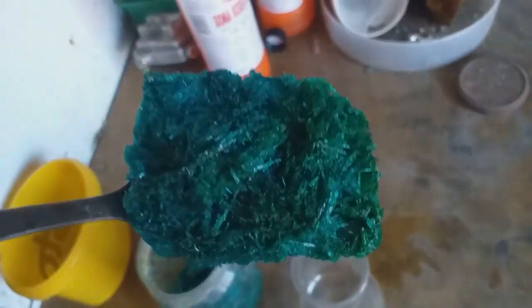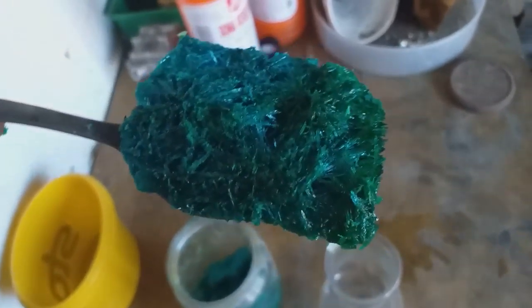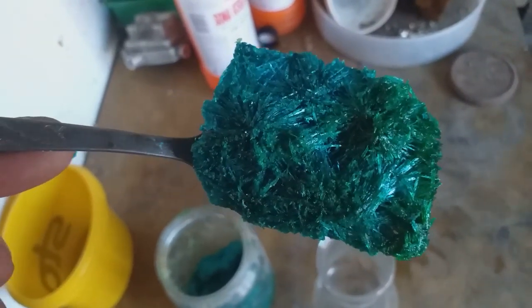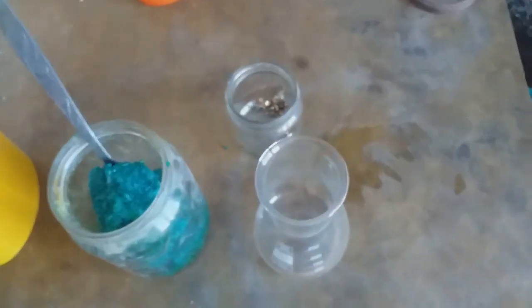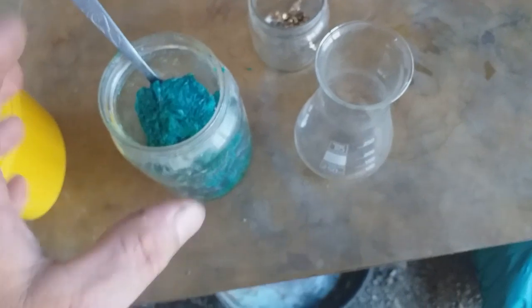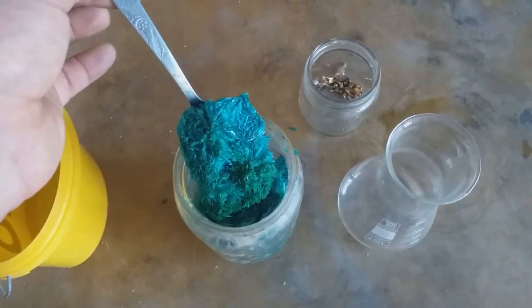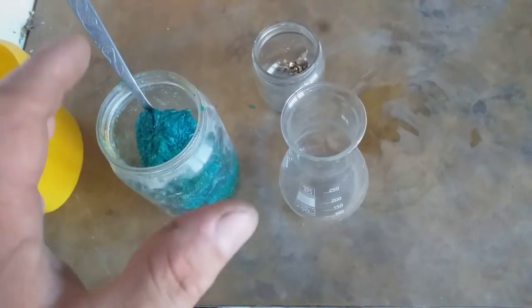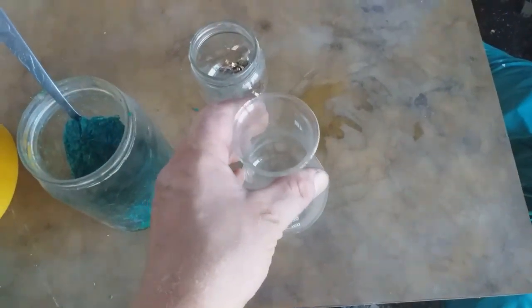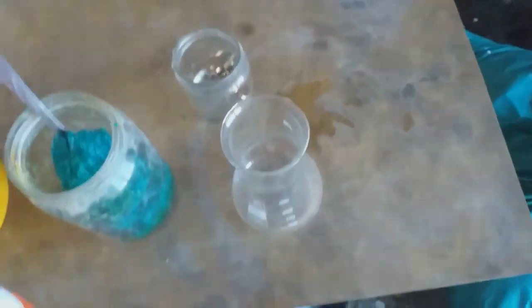But today we're not here to admire the shape — trust me, it's a very beautiful shape — but today we are here to use that stuff for an instant copper chloride or AP solution. I'm going to show you in this quick video how, if you accidentally have this stuff, don't throw it away. I'm going to show you how to make AP solution.